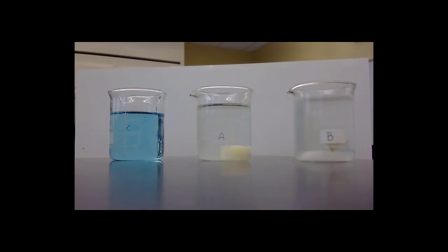Well, it's been about 45 minutes now, and as you can see, the methylene blue has spread pretty much evenly throughout that beaker. We have reached a state we call equilibrium, where everything is in balance, so I doubt that there will be much more spread, and this is just a byproduct of a passive process called diffusion, where things go from higher concentration to lower concentration.